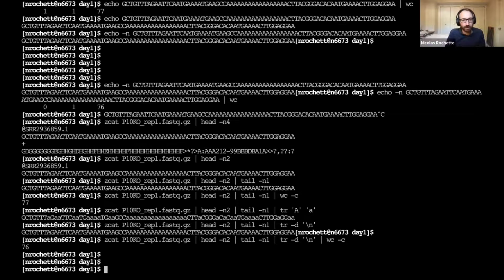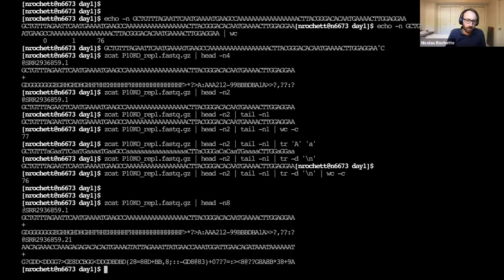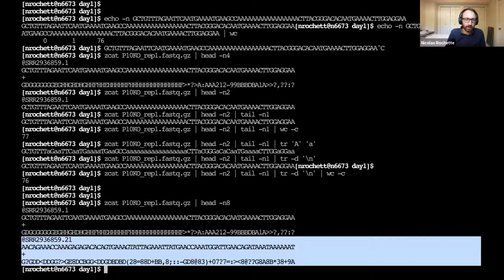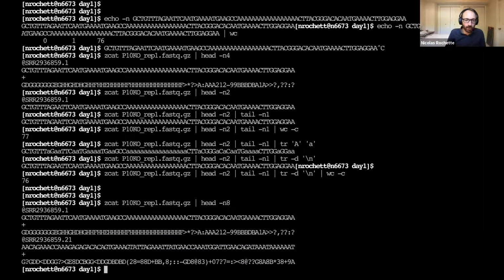So one thing I can show about FASTQ file is kind of a not very well-known tip, but it's often very helpful to build these small questions. And I'm not going to really explain how it works, but essentially, we can show the first 8 lines here. And we get the first 4 lines are the first read. The next 4 lines are the second read, right? And so we have these groups of 4 lines. And there's kind of this magic Unix command, which is paste, and then with 4 hyphens. And if you're interested in knowing what the 4 hyphens do, you can try to find the explanation on the internet, but it's kind of an advanced thing. But the fact is, when you're working with FASTQ file, it's just kind of magical.